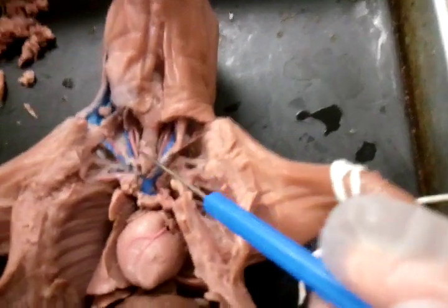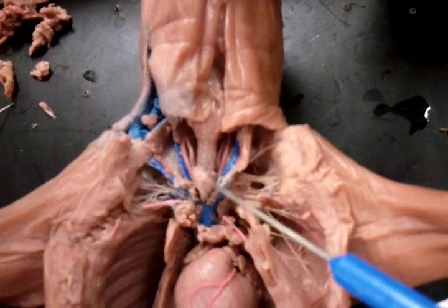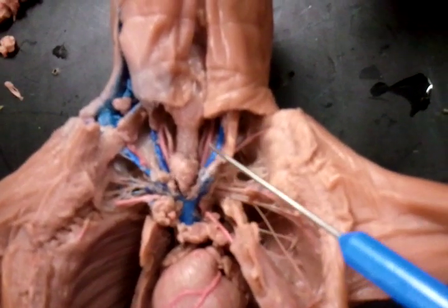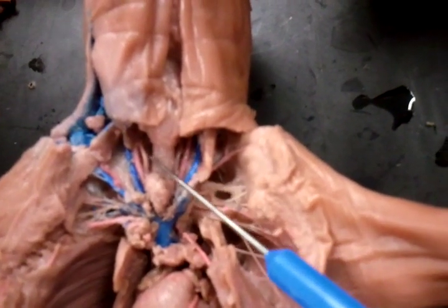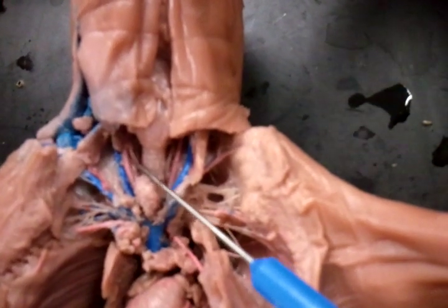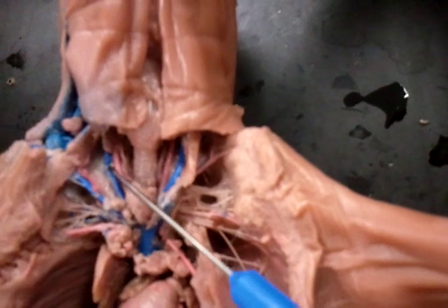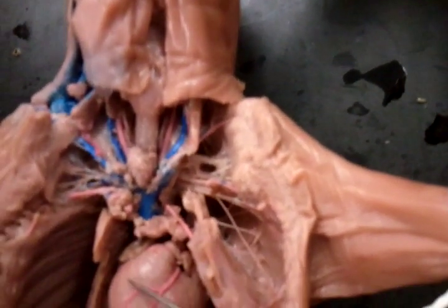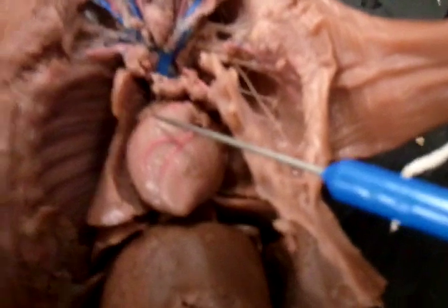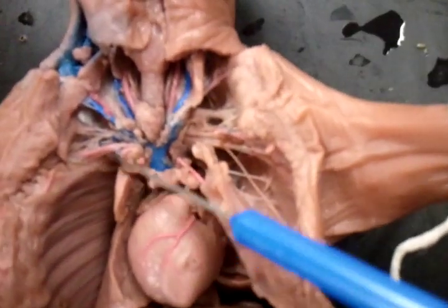This is the trachea, this is the thyroid, this is the common carotid artery right here, this little thing. External jugular, internal jugular, this is the subclavian artery.